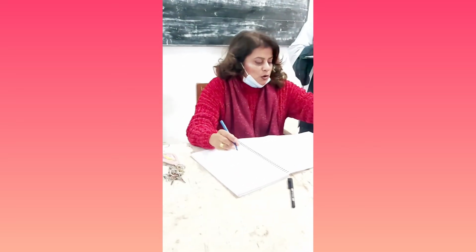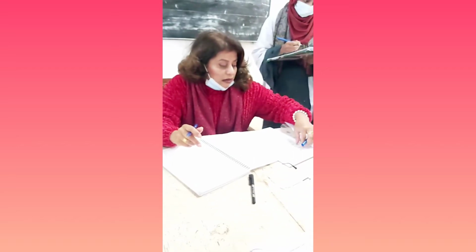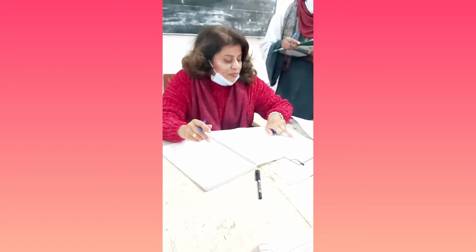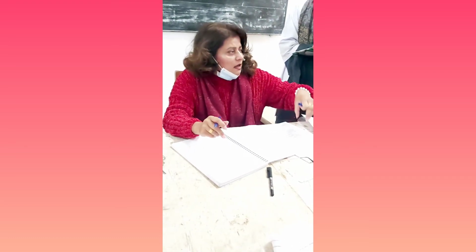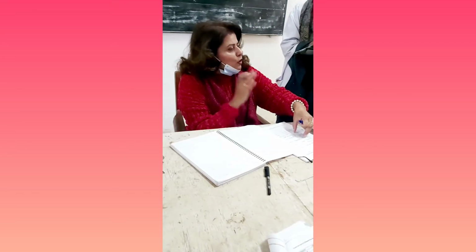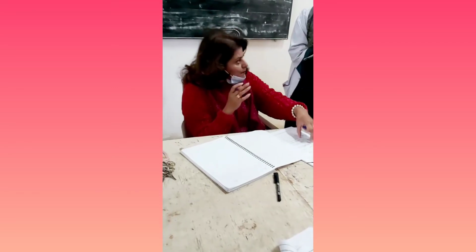In the same sense, you are going to do the test for sulfur and the test for halogens. But here the indications are given for the test for sulfur and for nitrogen present together. In test number 3, the test for halogens, they have already said that if your compound contains nitrogen and sulfur, then perform this.